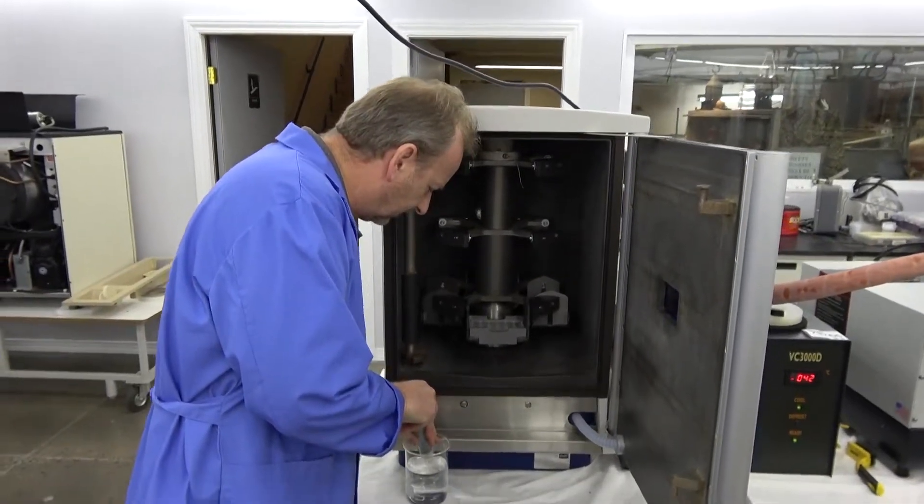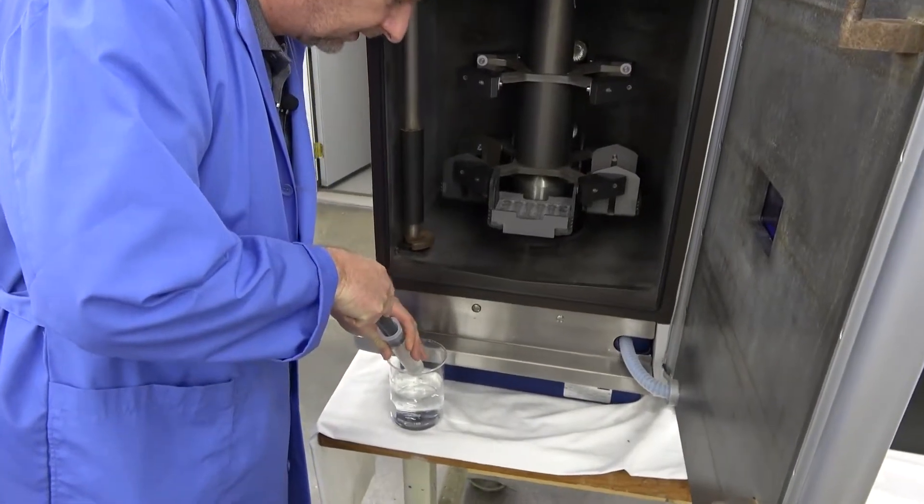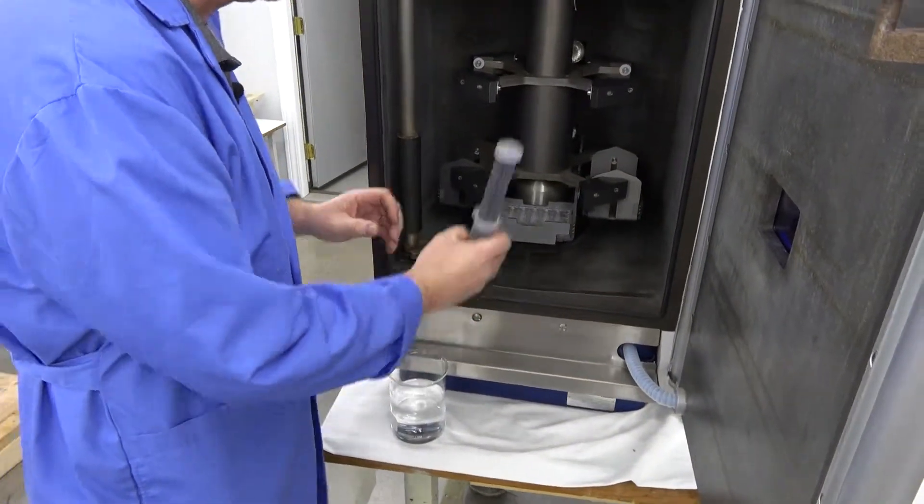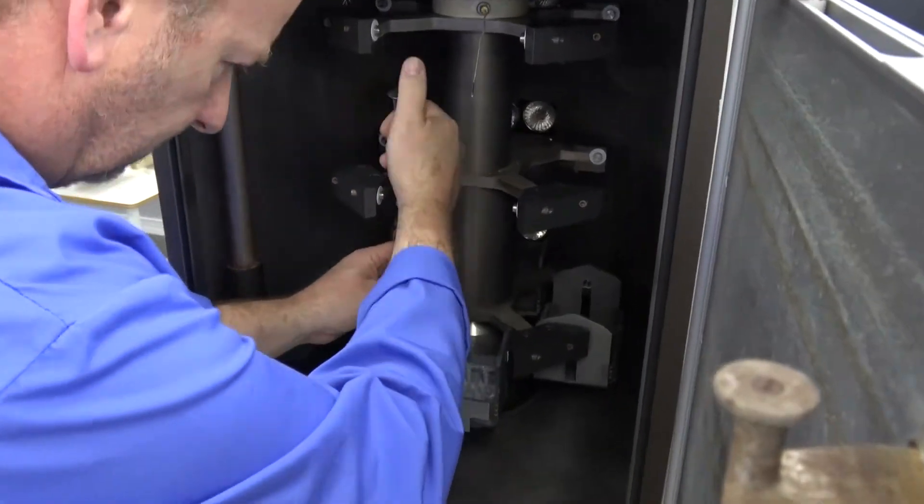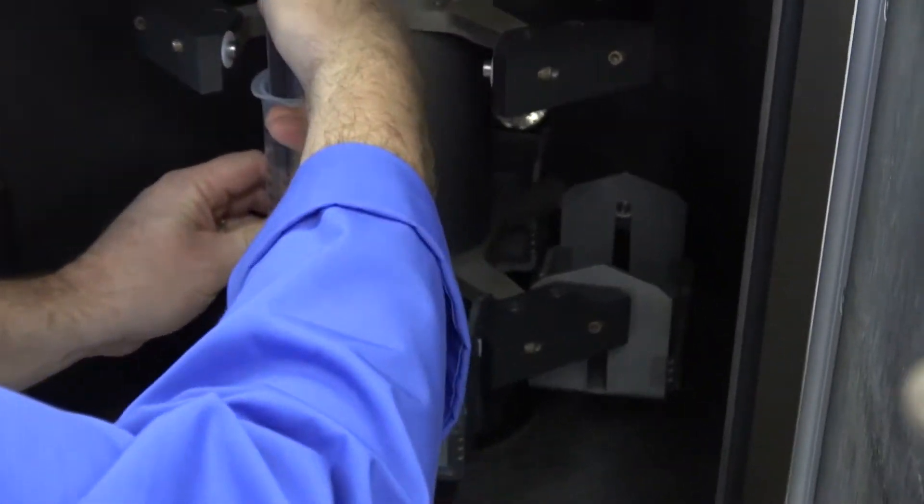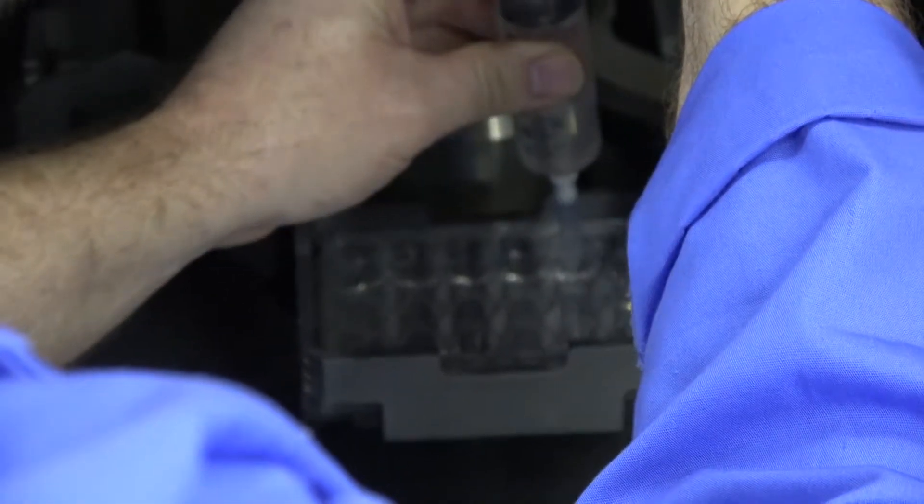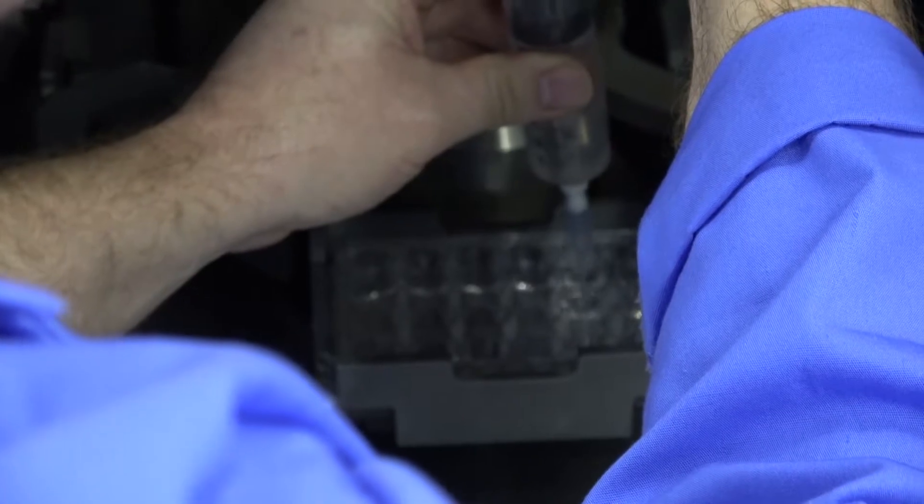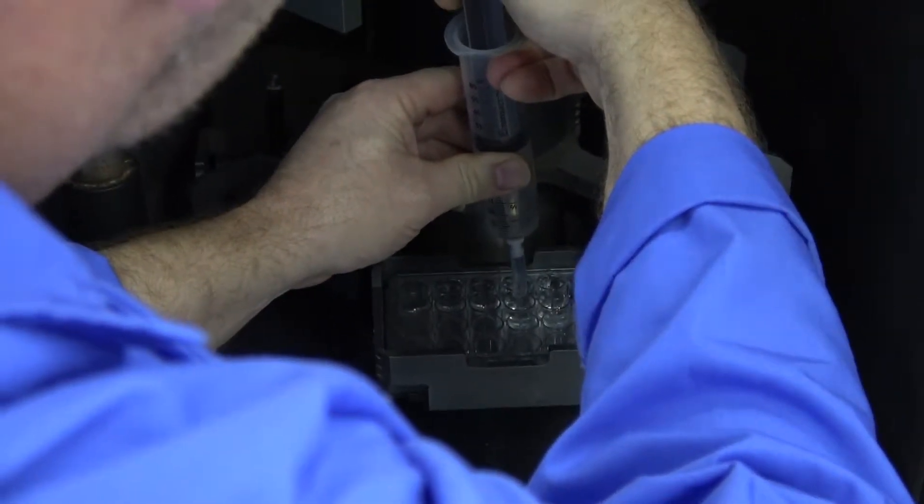Right now, I'm just going to go ahead and fill up all of the wells with water, and you could actually stack multiple plates on top too, but we're just going to do these.